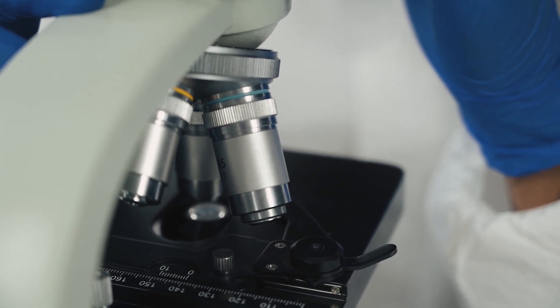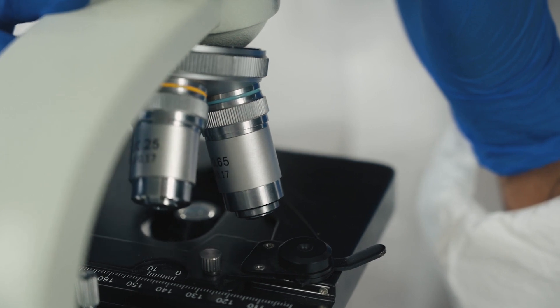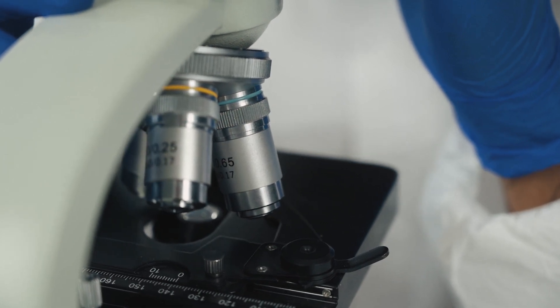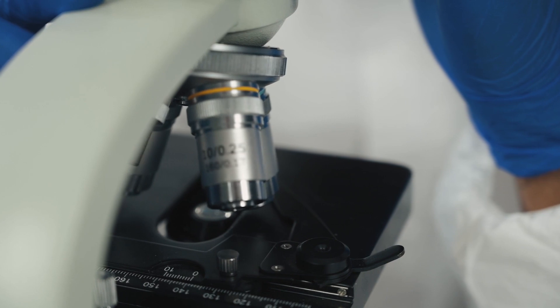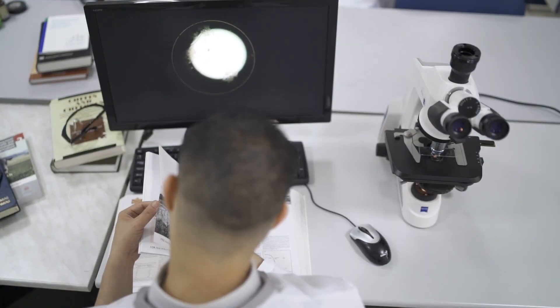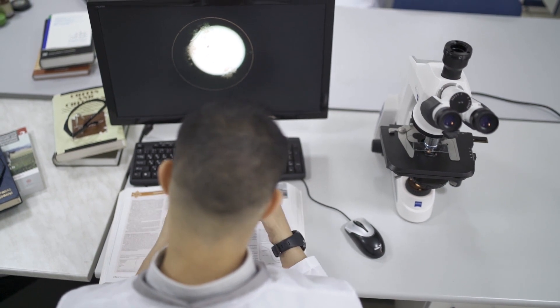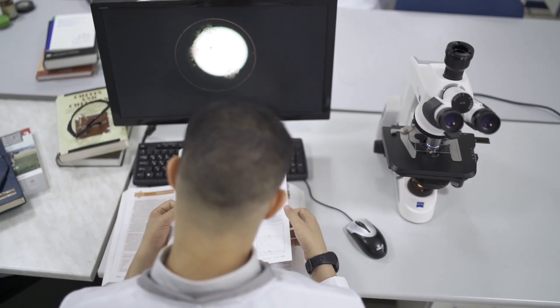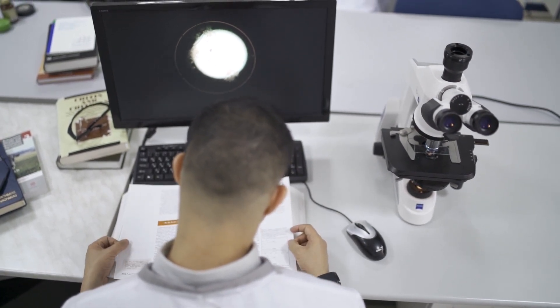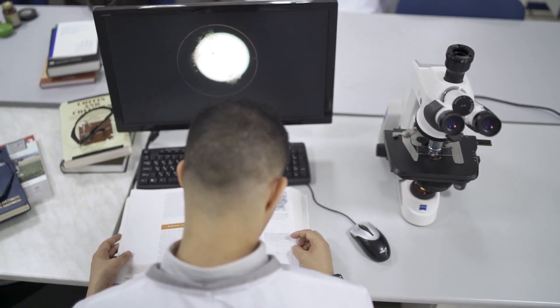More frequently, silver staining is used for things like amyloid beta proteins, where you're not so worried about whether or not you're going to cause damage, as the amyloid plaques are already a damage product but also something you really need to be able to figure out. The build-up of a large amount of silver material becomes a very dark and very obvious spot.